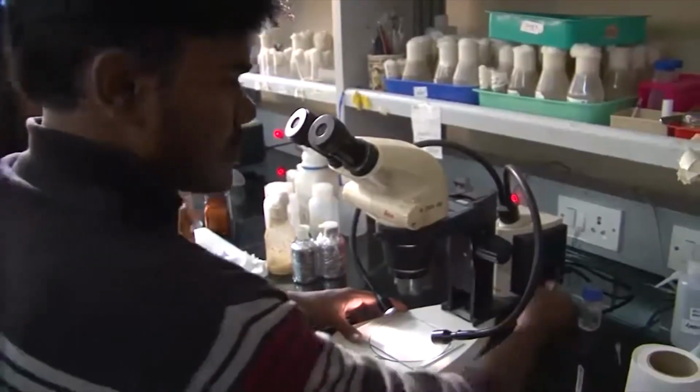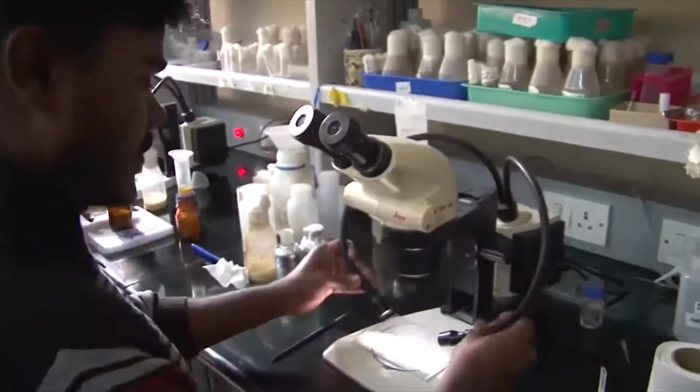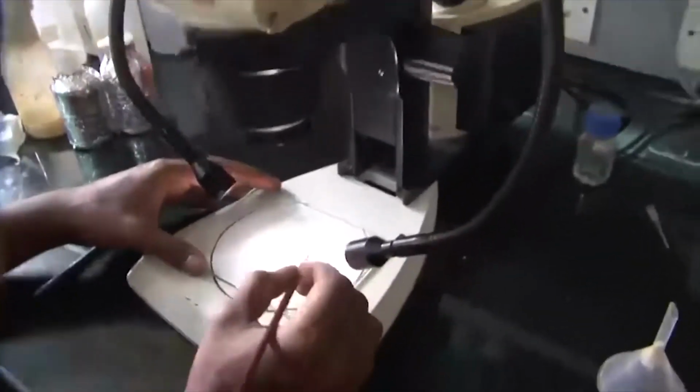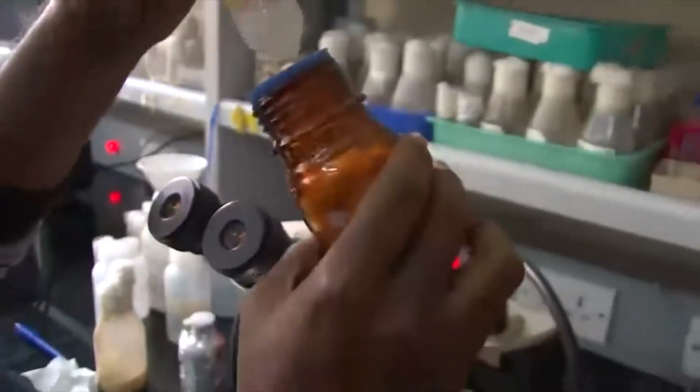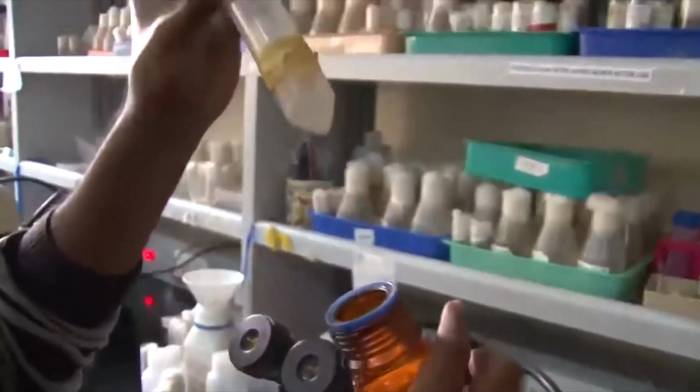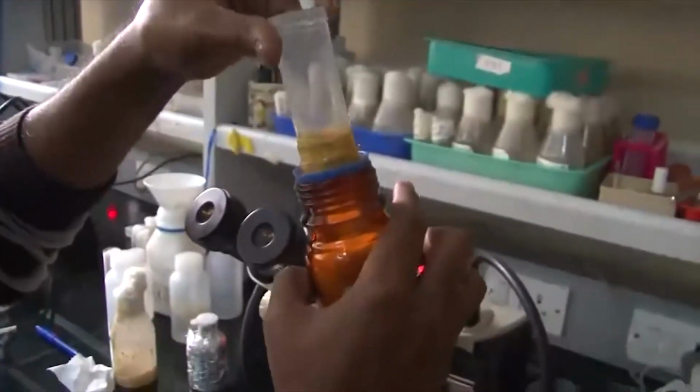This is a dissecting microscope. What we have down here are adult Drosophila flies. These are normal wild type flies, just etherized using diethyl ether in a setup. We made this indigenous Drosophila etherizer. It is nothing but a carton and a perforated plastic vial, over which a funnel was kept.